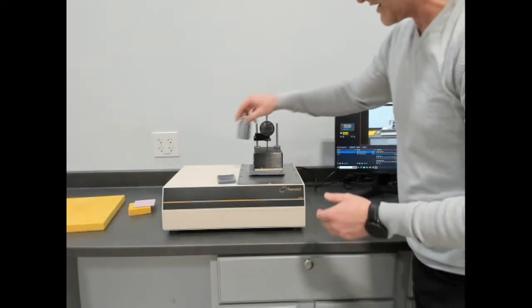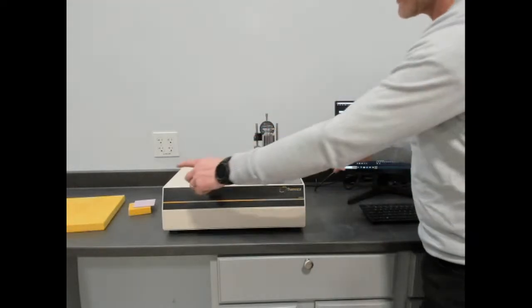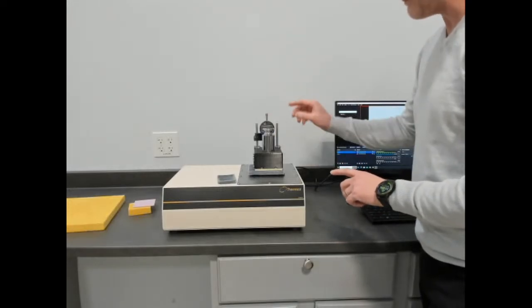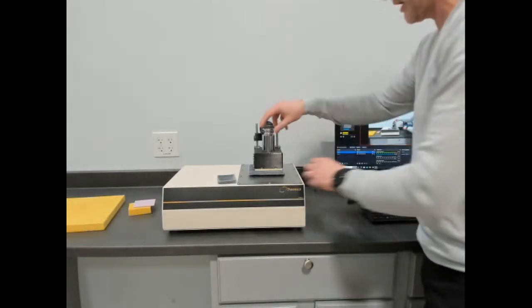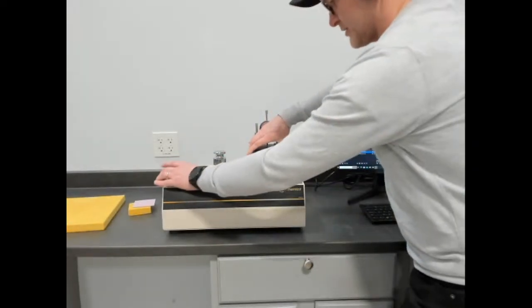We are using a standard weight. That standard weight is part of the calibration as well. So when we calibrate with 1450E, we are using the same material, the same weight. And that becomes part of the experiment. So I'm going to revert back to the initial piece of XPS.